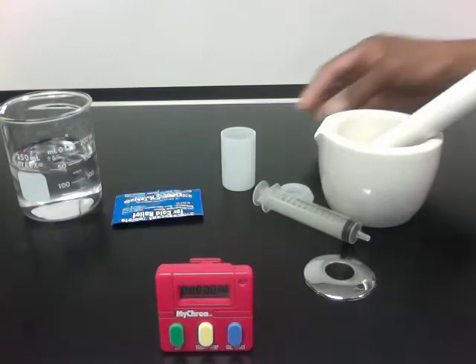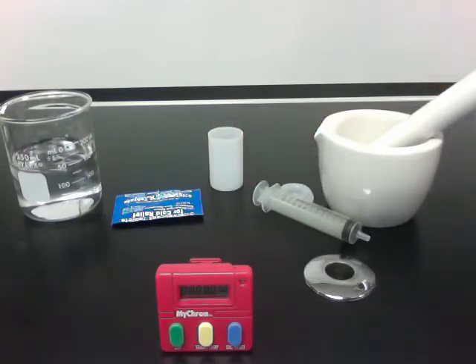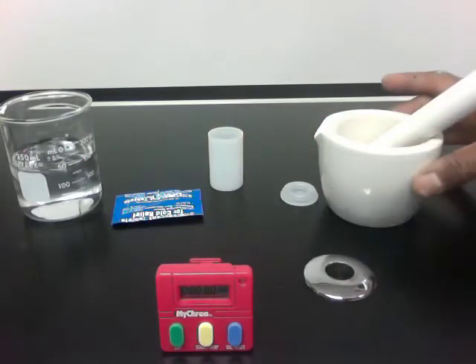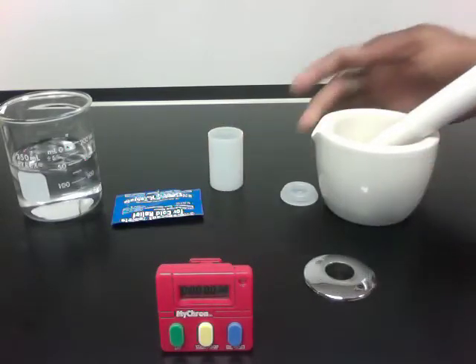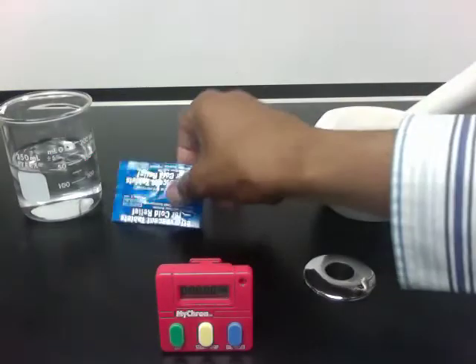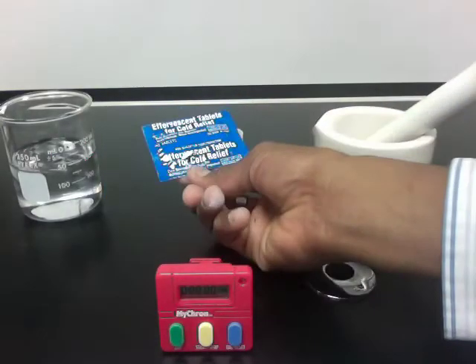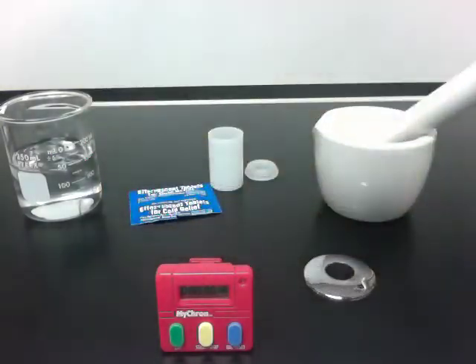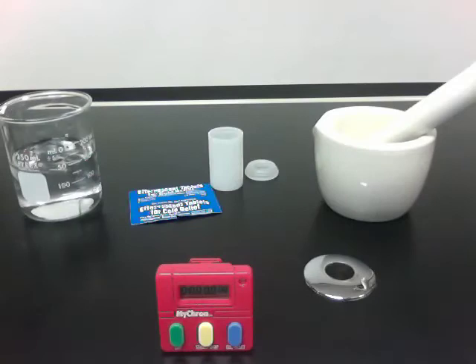We have a film canister, a mortar and pestle, some effervescent tablets, a timer, and a beaker of water.